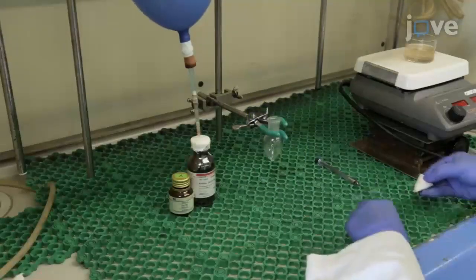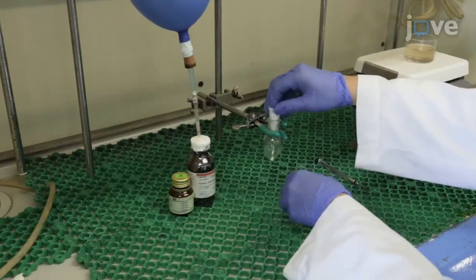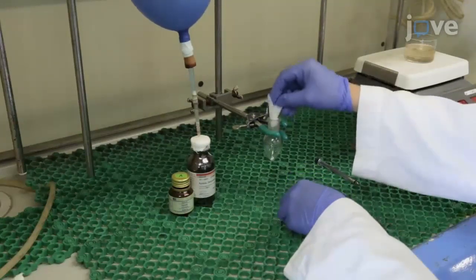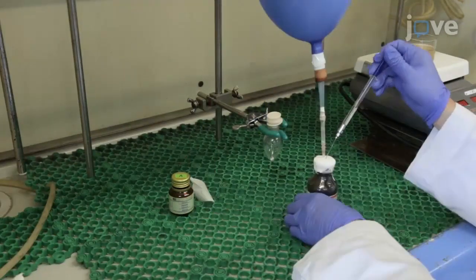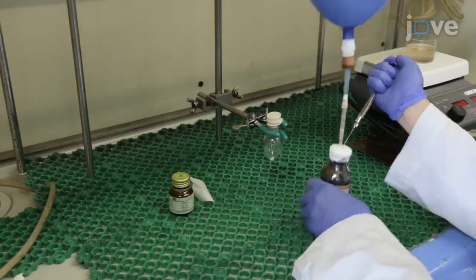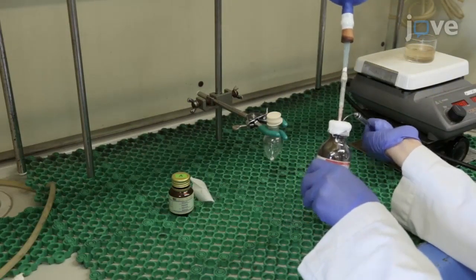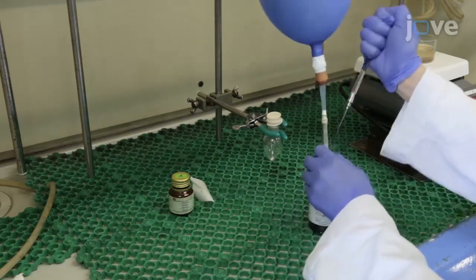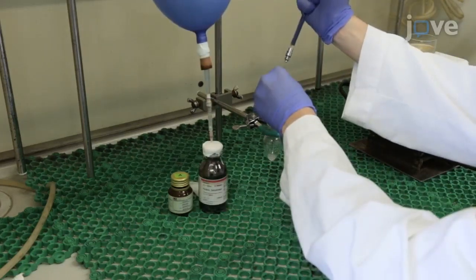Begin with the temporary protection of the 2-prime, 3-prime diol of ribonucleoside by dissolving 20.4 milligrams of adenosine-13 in 0.76 milliliters of anhydrous pyridine in a 10-milliliter pear-shaped flask.